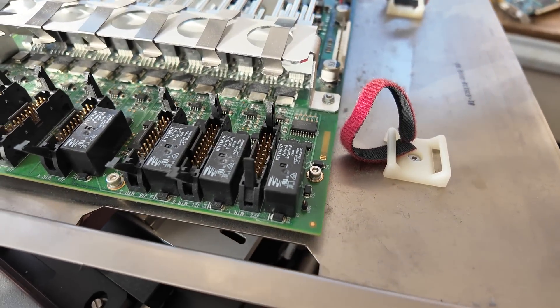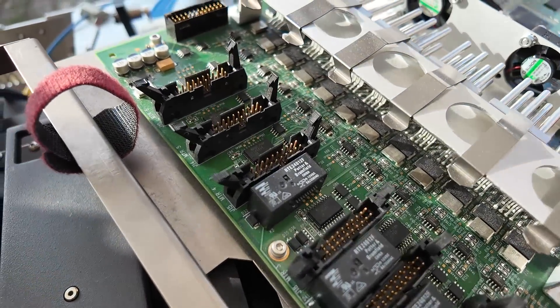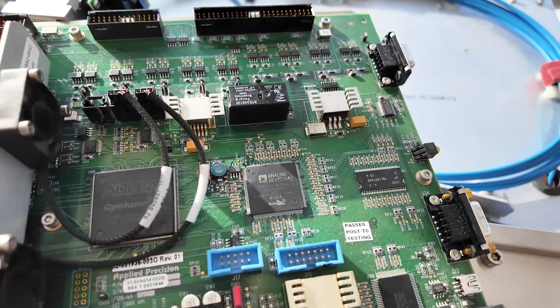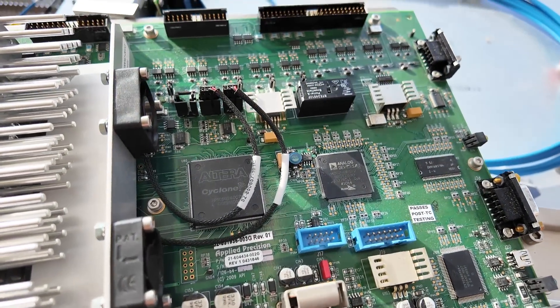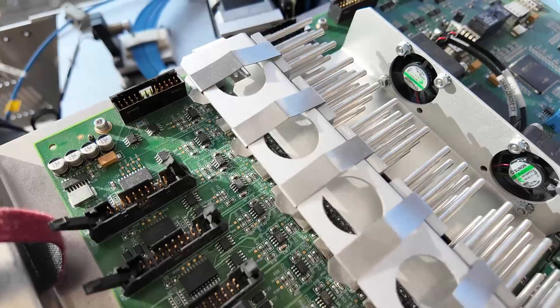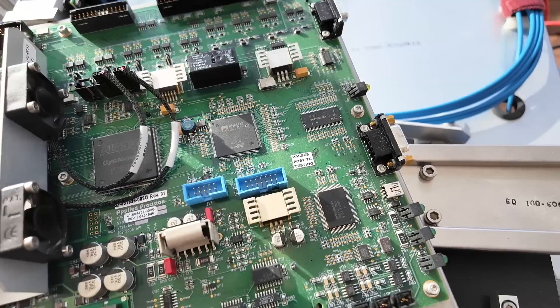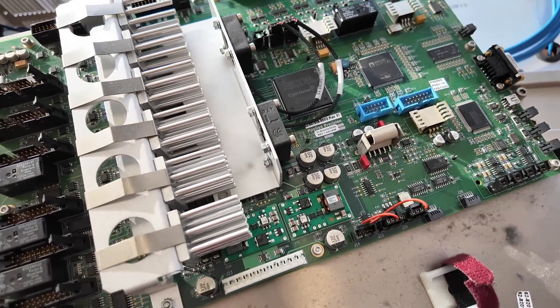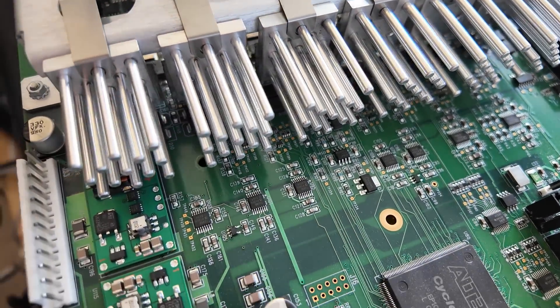This is just the most ridiculous stepper motor driver I've ever seen. If you're building a piece of kit like this, why would you not just buy off-the-shelf driver modules or ICs? Maybe they want super-smooth movement, but even so you'd move it and then take the pictures — you wouldn't try using the camera while the thing's on the move. I'd be interested to know why you'd use something this complex for what is basically controlling three stepper motors and a few outputs like a latch solenoid for the cover. Under the fan bracket we've got a load of 10-bit D-to-A converters driving those op-amps.